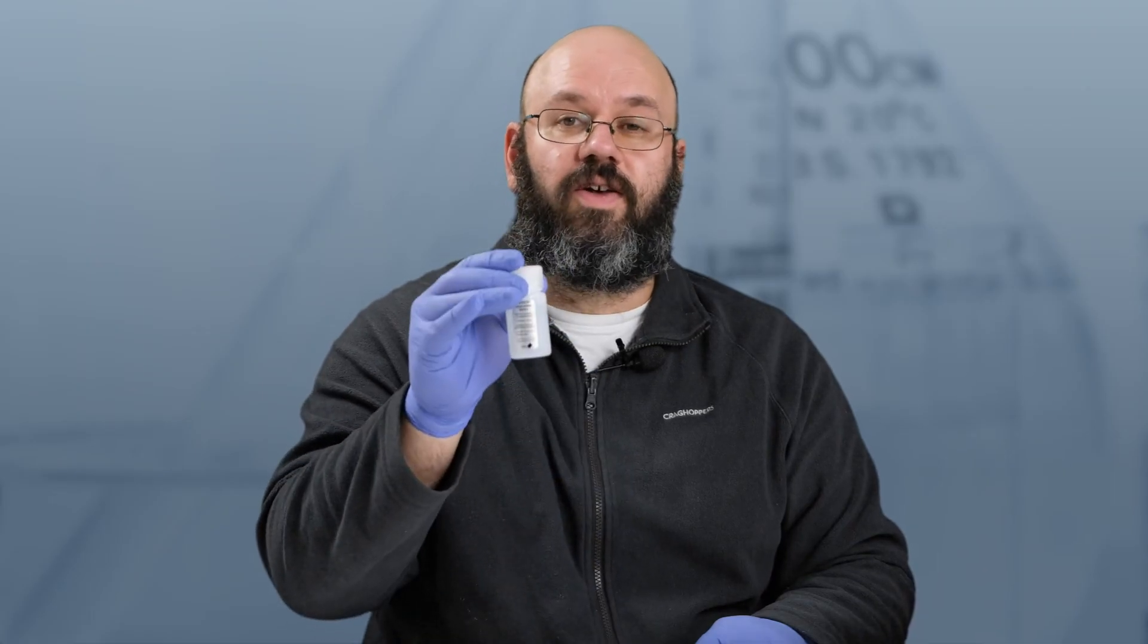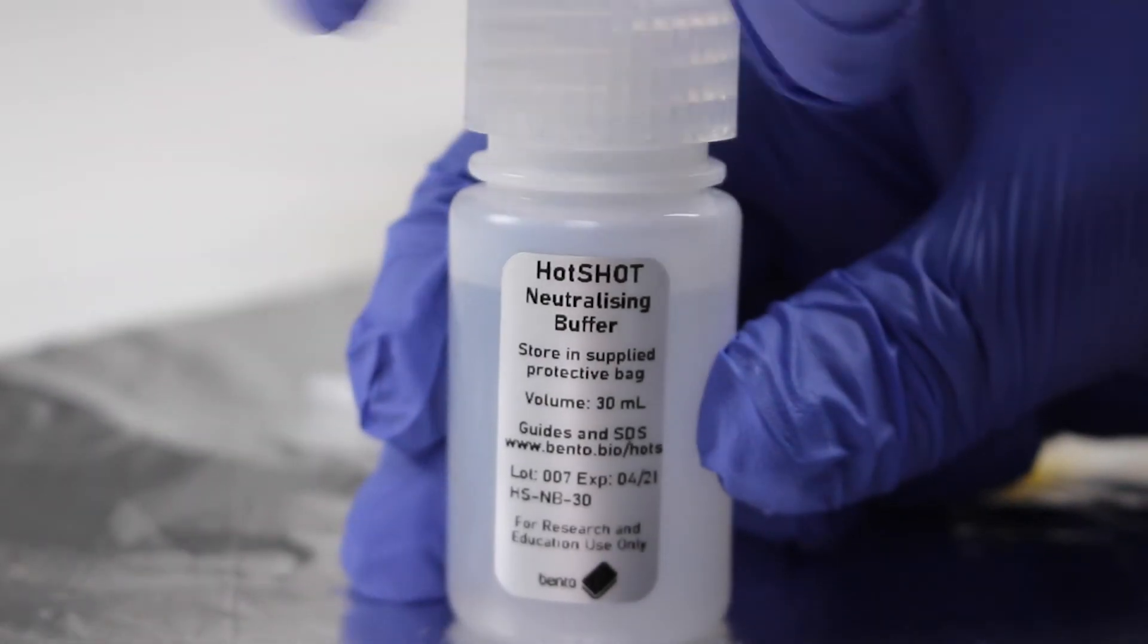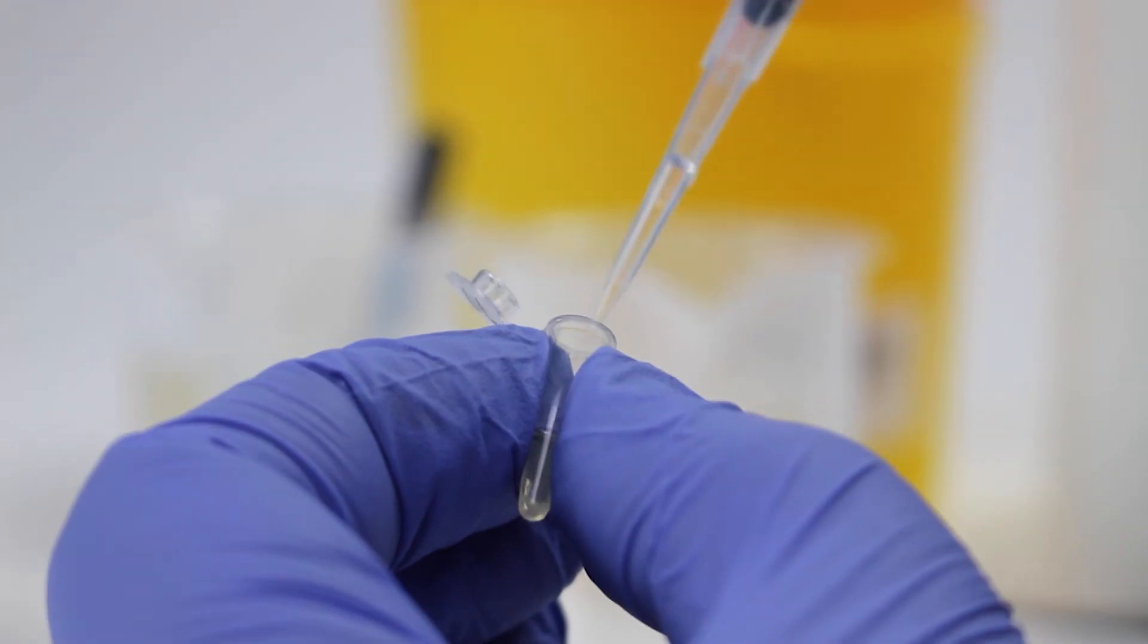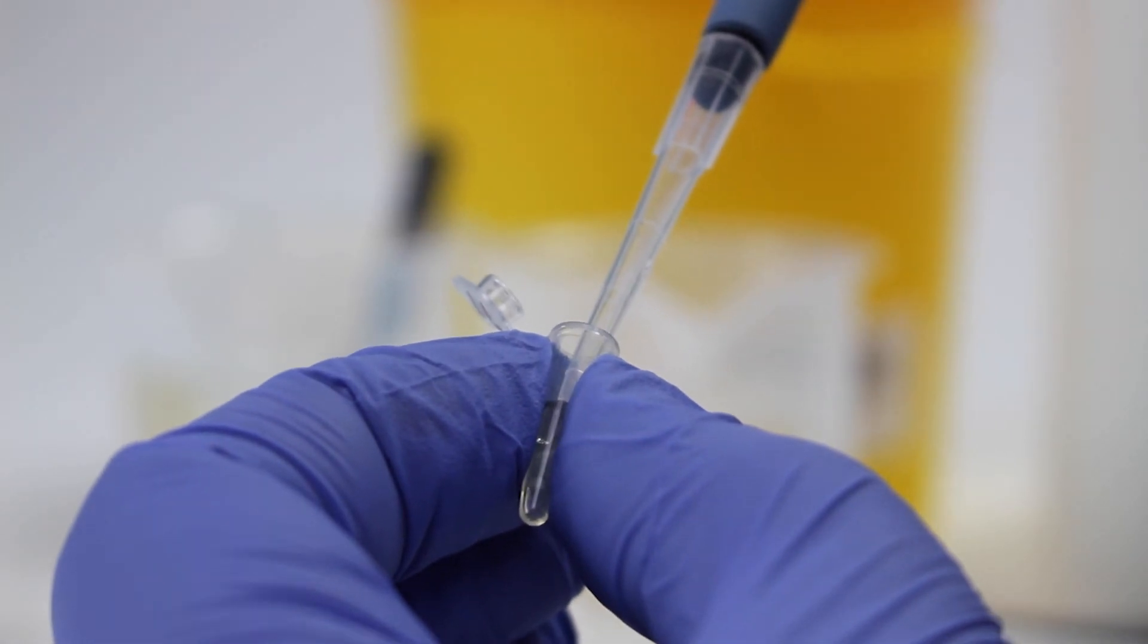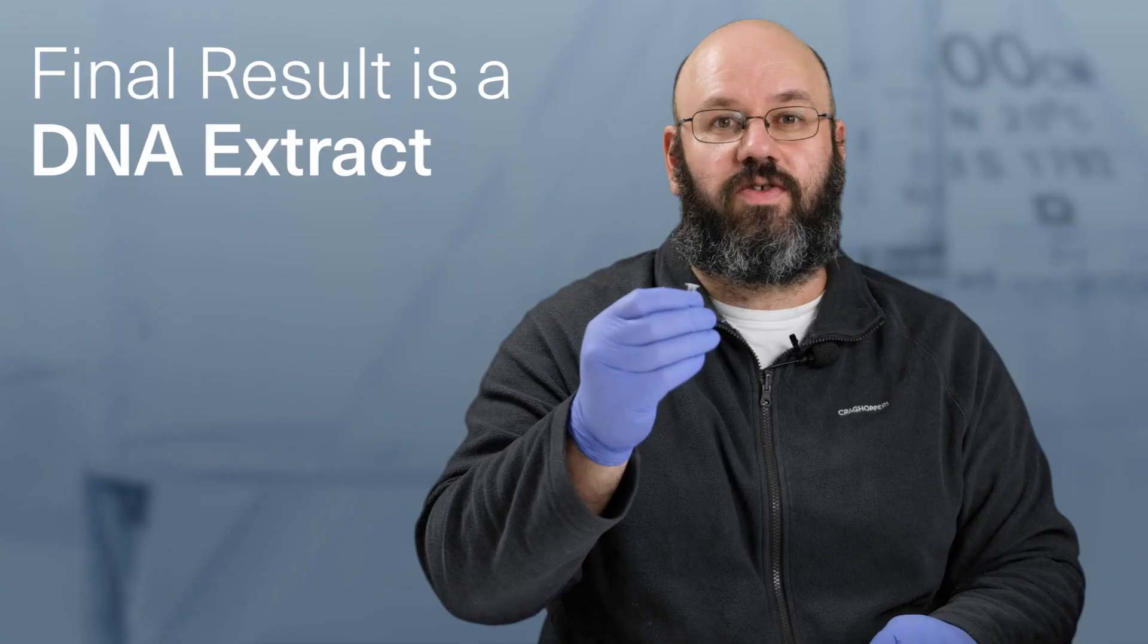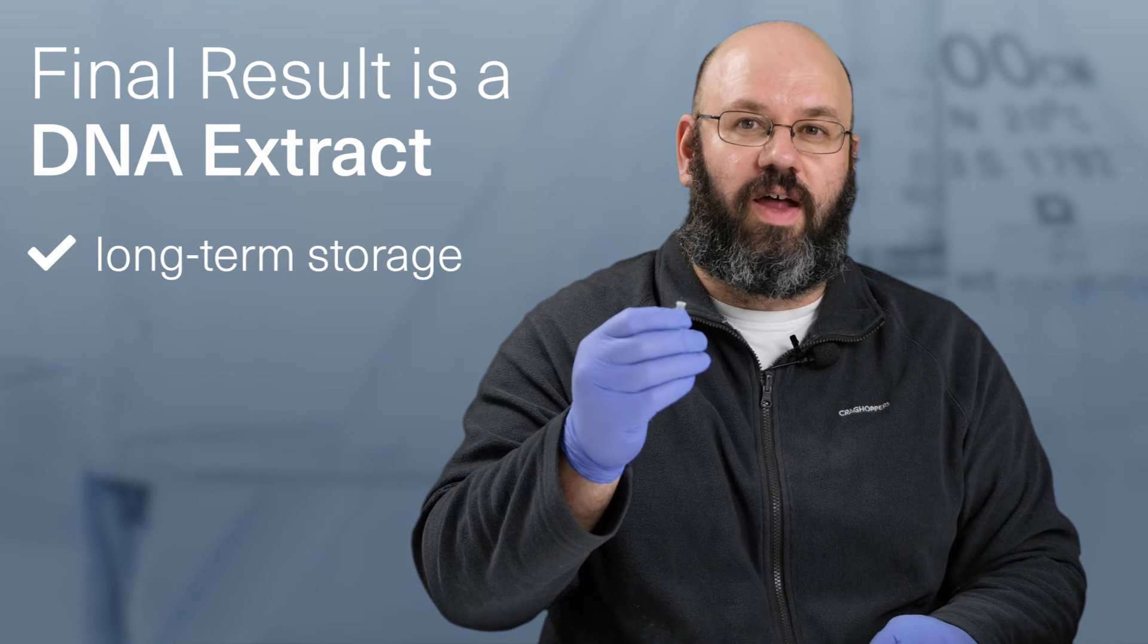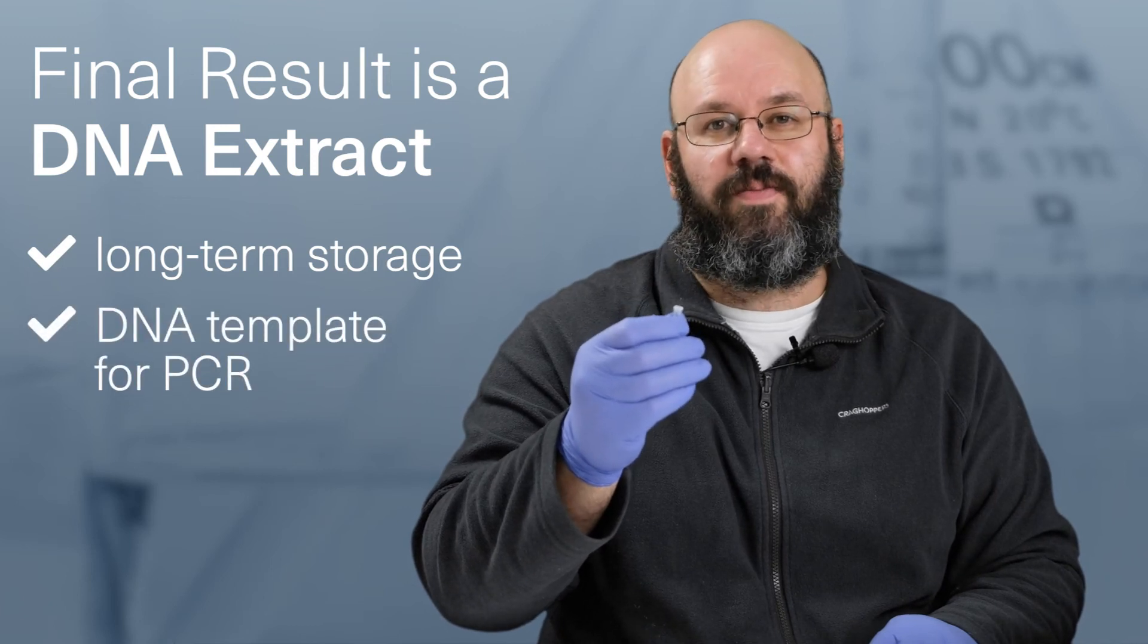After incubation, I'll be adding the neutralizing buffer. Once this is done, the liquid in the PCR tube is a DNA extract in a pH buffer suitable for long-term storage and for use as the DNA template in PCR.